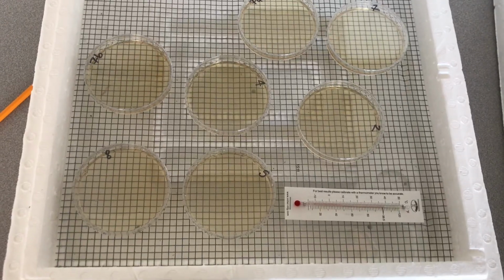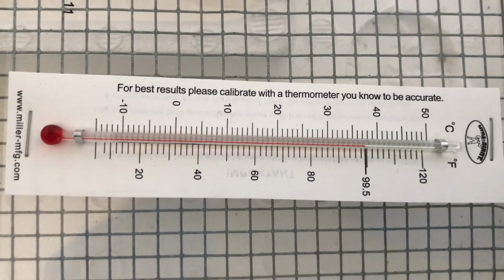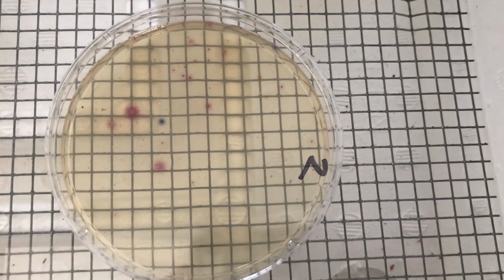And we'll also be testing for E. coli, which is a bacteria that is extremely harmful to humans if ingested. So I'll show you how we do that. So this is our incubator, and this is where we've been incubating our E. coli samples. What we're looking for to test for E. coli are blue dots. So if you see any blue dots, that's an indication that there is E. coli in one of our water samples.